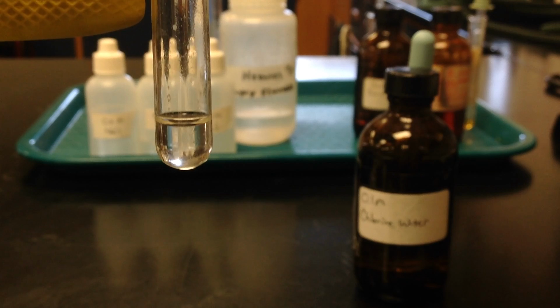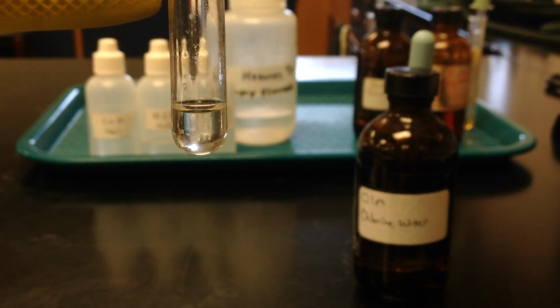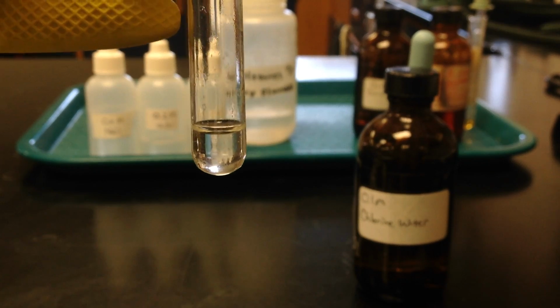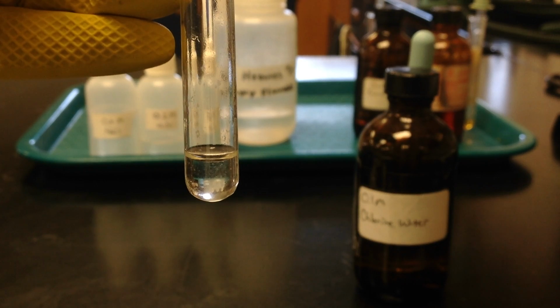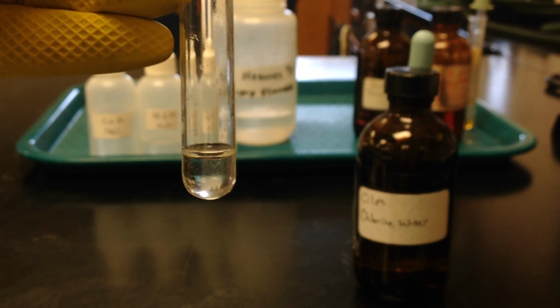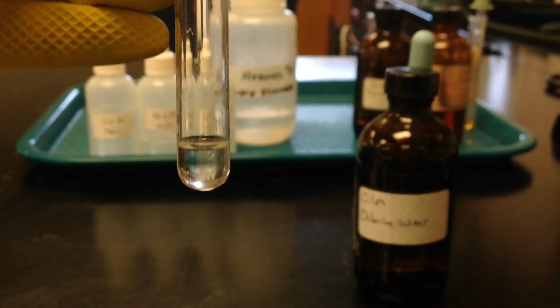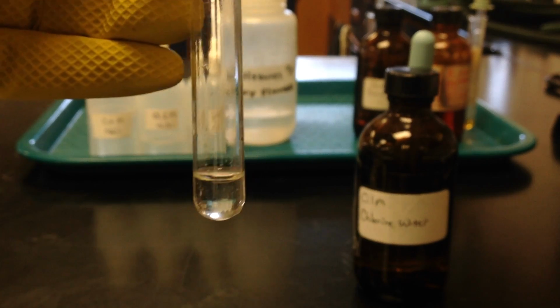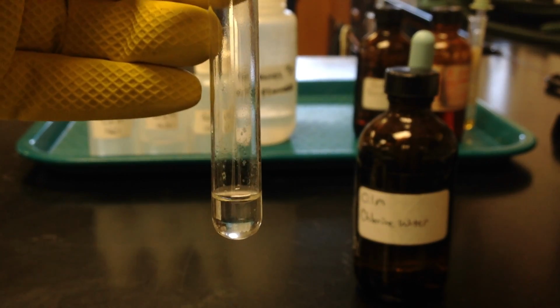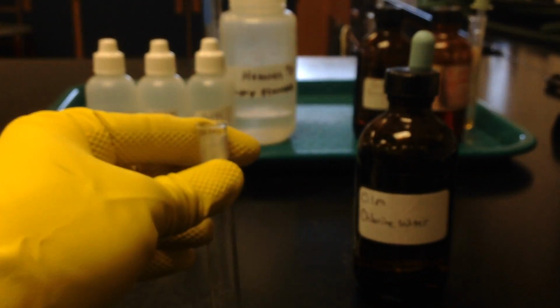These chemicals often smell like the odors that you'd find at a swimming pool because they often use chlorine chemicals or bromine chemicals to disinfect the water. So if you're watching this video, you won't be able to smell those fumes. But again, what we're trying to do is keep those fumes to a minimum. So we're doing this experiment under a lab vent fan, and we're also closing up those chemical bottles as soon as possible.